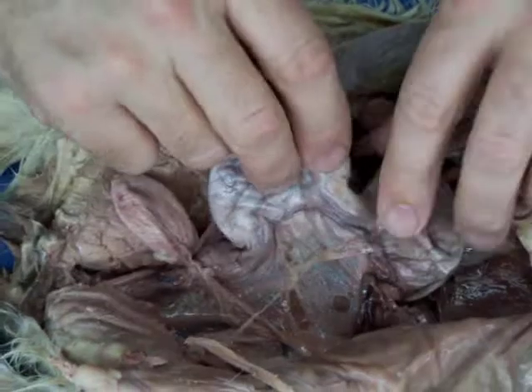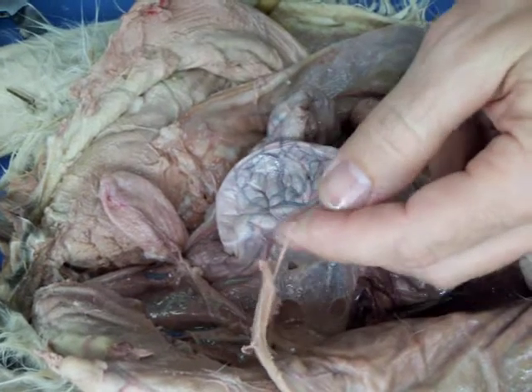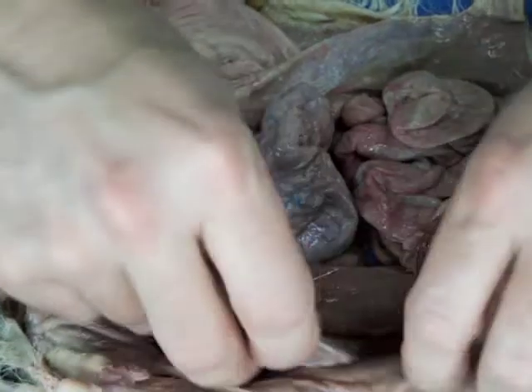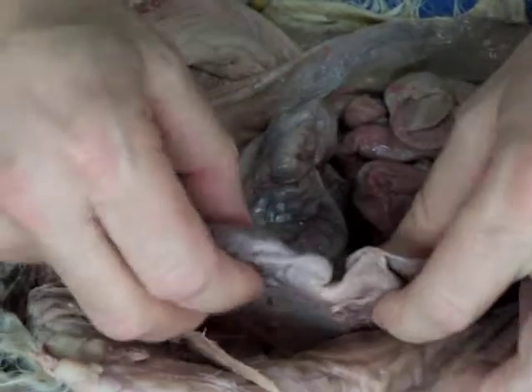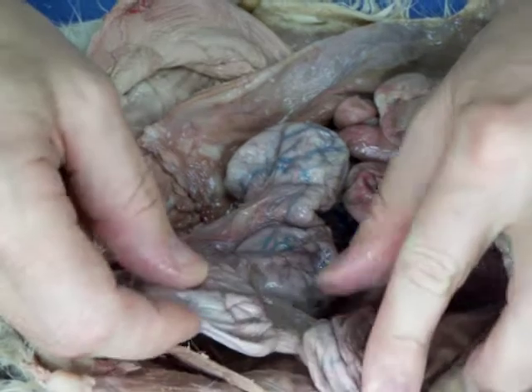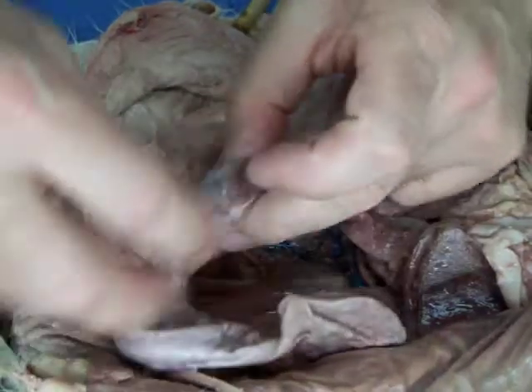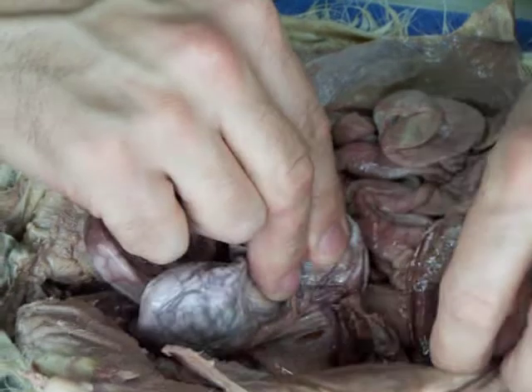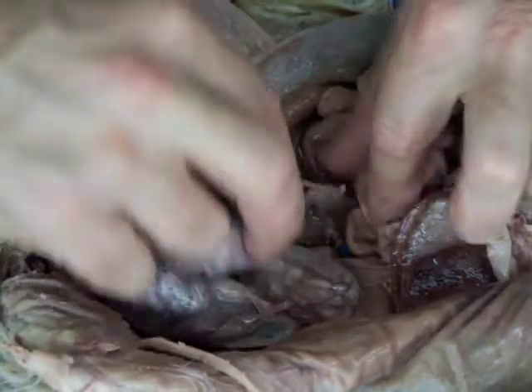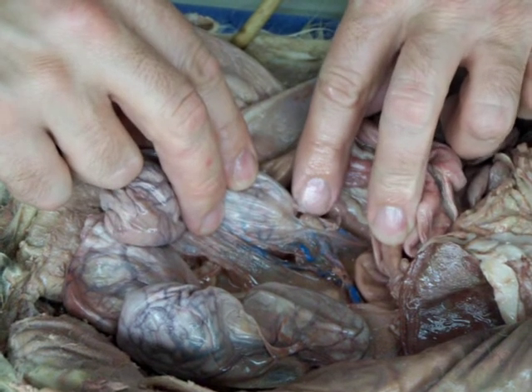Now, if we look at the major features of the uterus, these are all little placental packages here, parts where the implantation has occurred and the uterus has expanded for the kits. And up here, let me see, it's easier to see on this one, really makes the ovary look tiny. Here's the ovary right here.